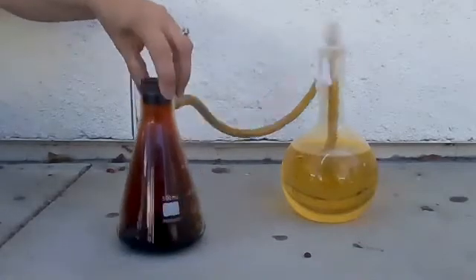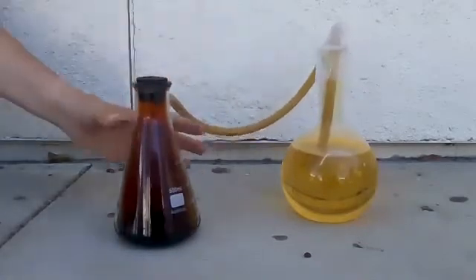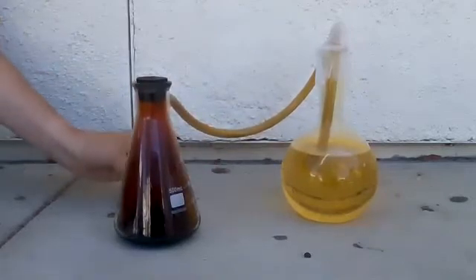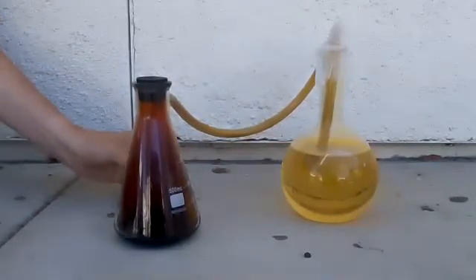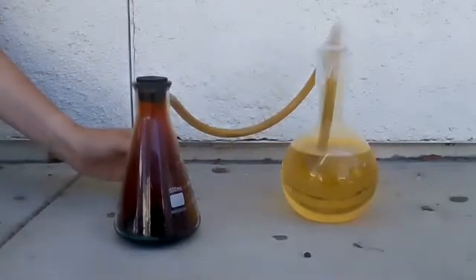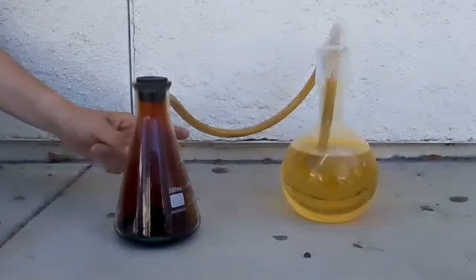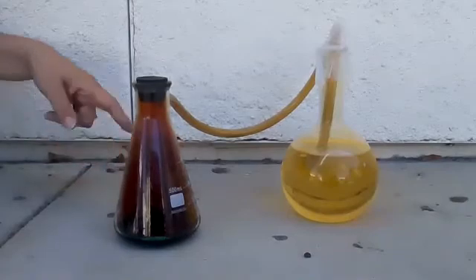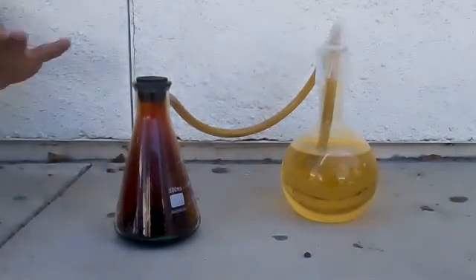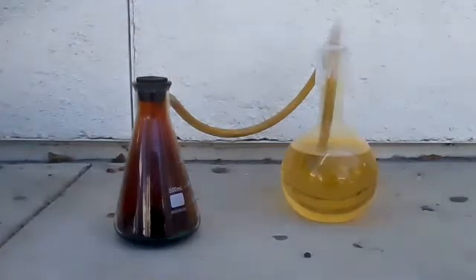So what is that going to do to this little tube? If the gases start shrinking, it's going to create a vacuum. The vacuum part is the cool part — we've seen the majority of it, but the vacuum part is the cool part.